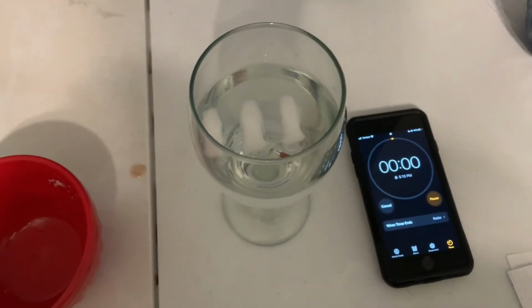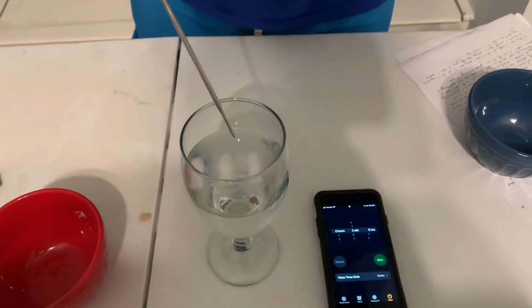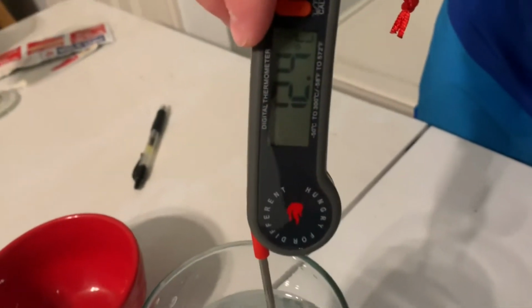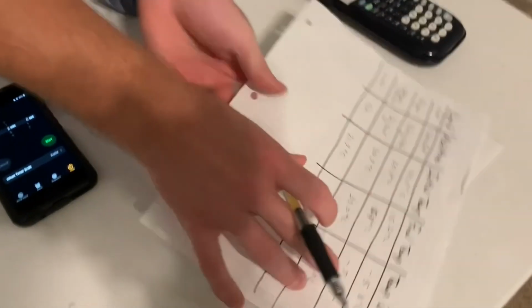All right, our time is up. We're going to check our temperature. So, as usual, we use our thermometer, and we're going to put it down here in our water. Now, ice water. Let's see what the difference in temperature is. Oh, wow. It looks like we've dropped down to 12.4 degrees Celsius. So I'm going to write that down here on our table.